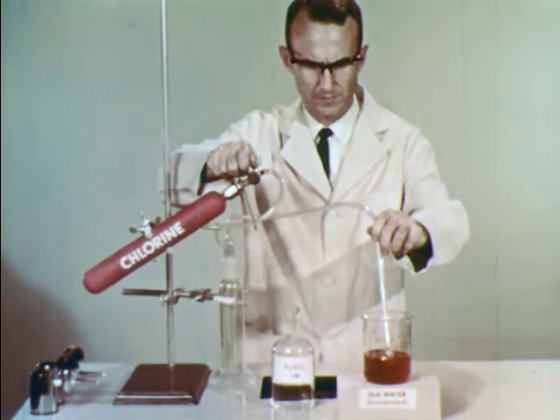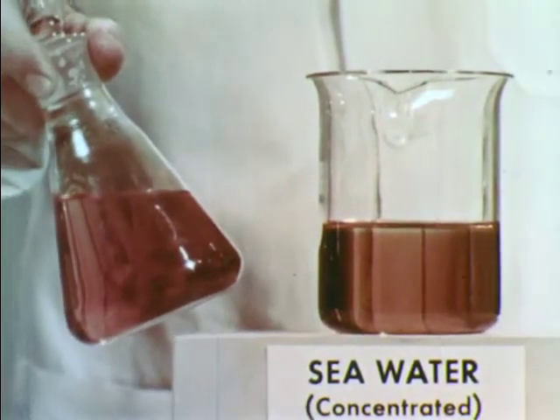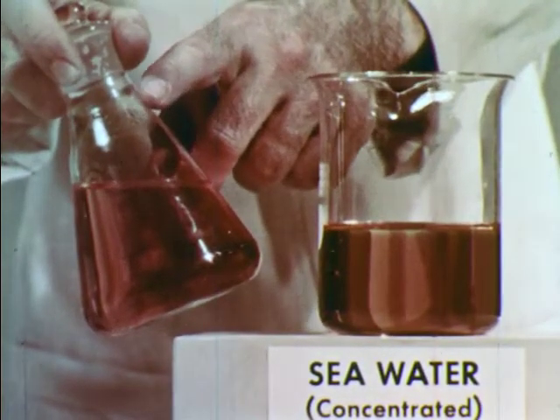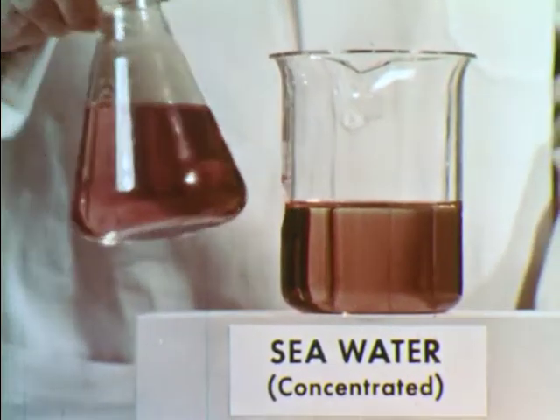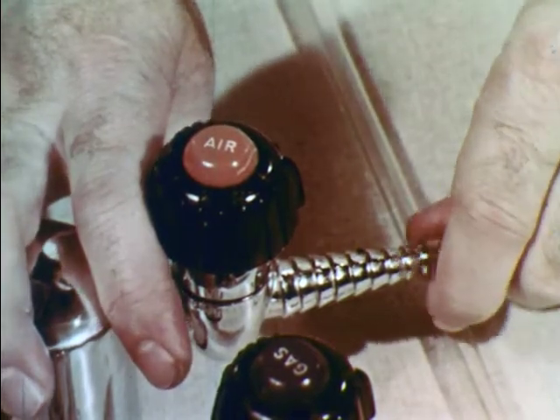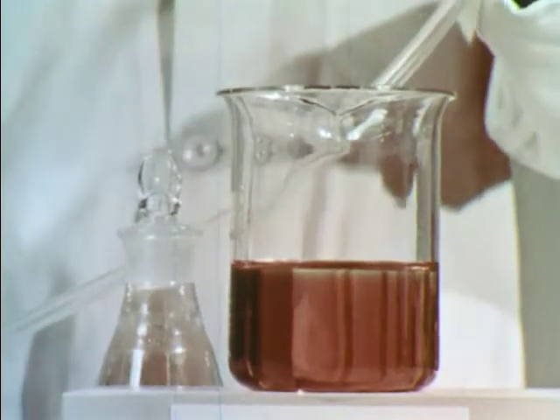Now, how can the bromine be extracted from this solution? Let's compare it with a stoppered flask of aqueous bromine from our earlier experiment. A considerable amount of the volatile bromine has accumulated in the airspace above the solution because of the low solubility of bromine in water. This suggests that if bubbles of air are forced through the solution, they will carry away the volatile bromine. A source of compressed air is connected to a dispersion tube, and the air bubbles sweep the volatile bromine out of solution. However, in order to concentrate the bromine from this dilute gaseous mixture, we'll need more controlled conditions.